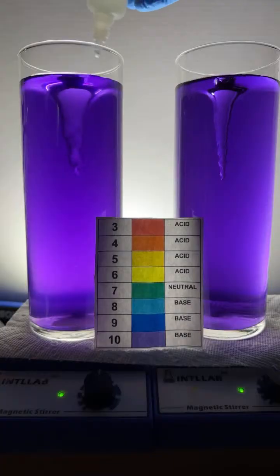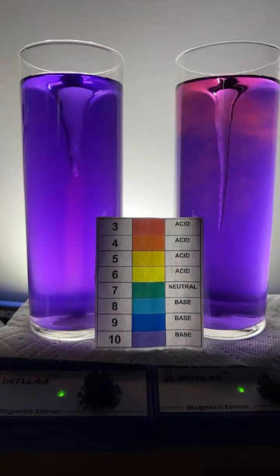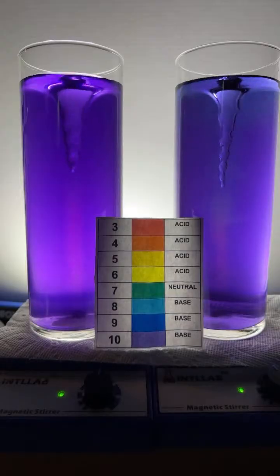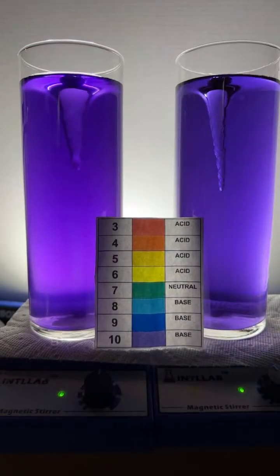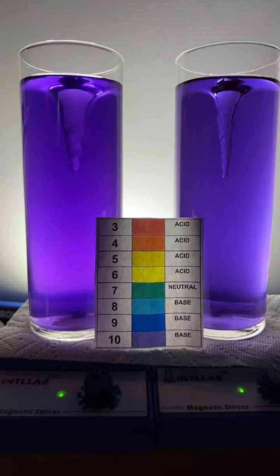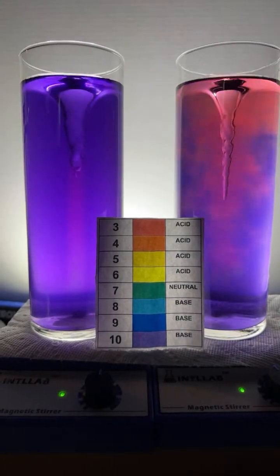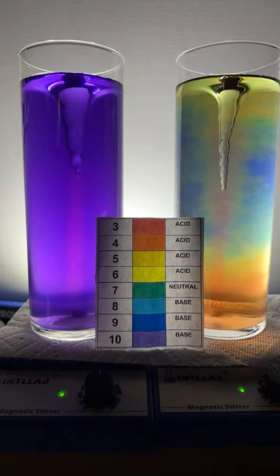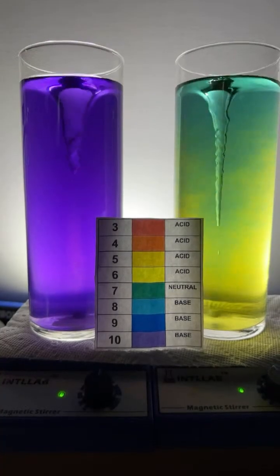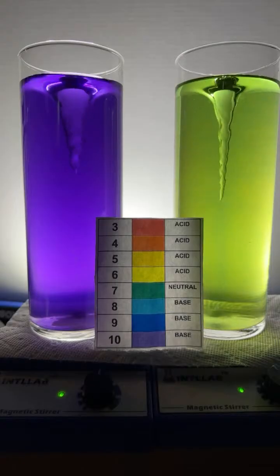So I'm going to start adding some acid to both flasks to lower the pH a little bit. Hello there, Zook. People are wanting green and blue. Sergio, this is hydrochloric acid that I'm adding. So as I try to lower the pH, I'm going to add acid. All right, I got to add a little more. We're going to add a little acid over here, a little acid over here. The acid I'm adding is hydrochloric acid. That's right, and I'm using sodium hydroxide as the base. I'm going for green or blue. I'm trying. Where do I get the acid from? There's your green, by the way.